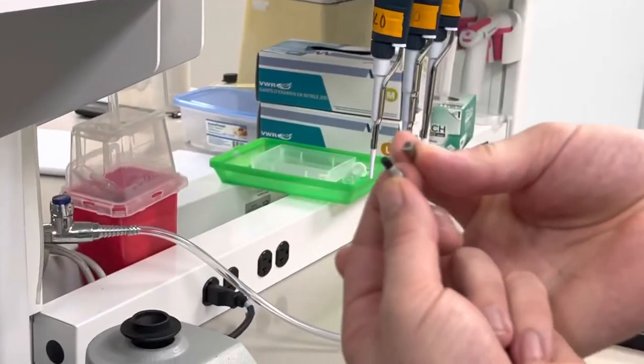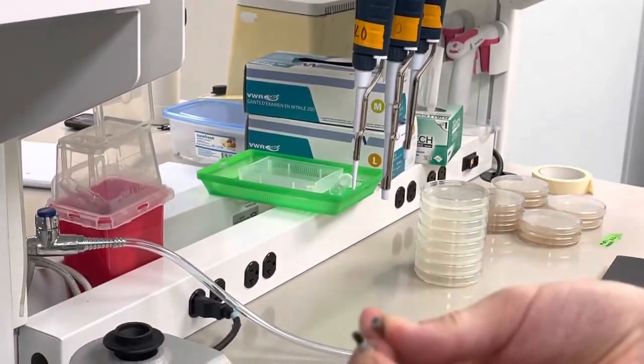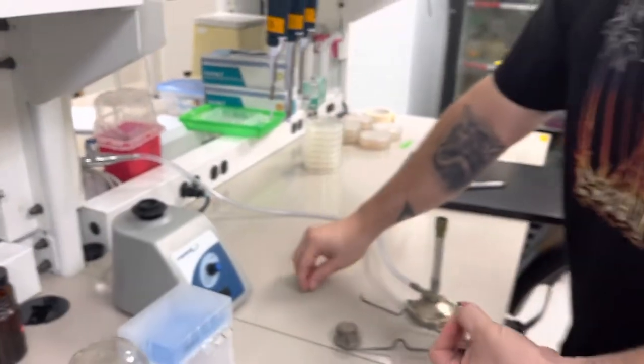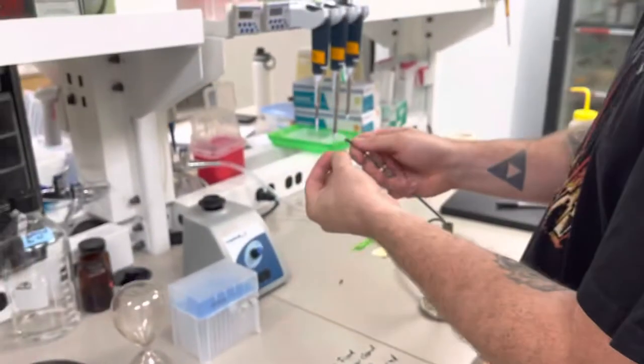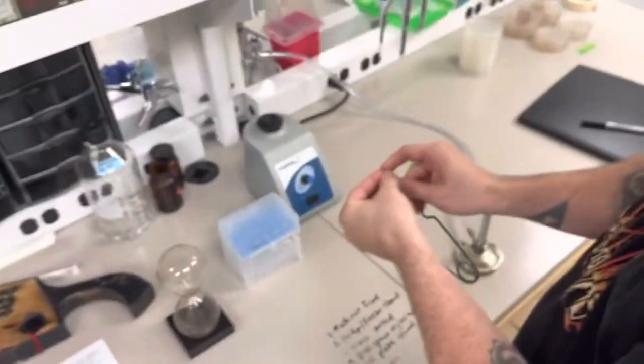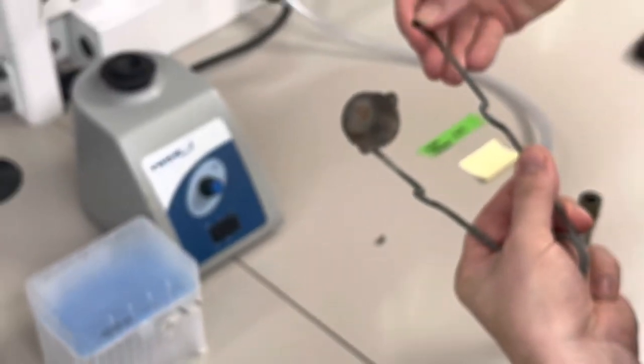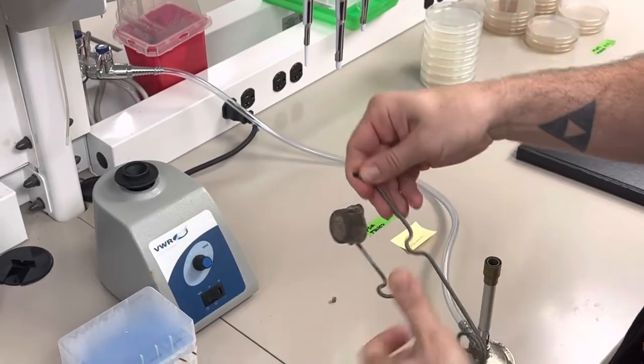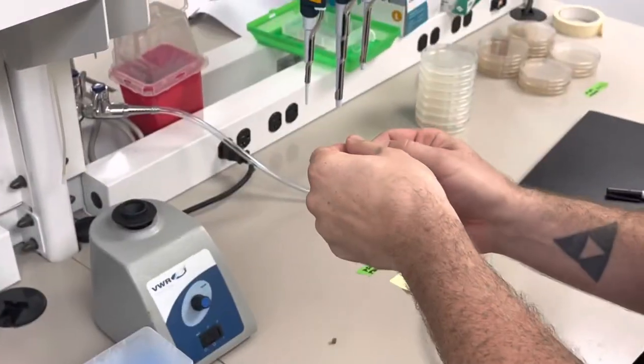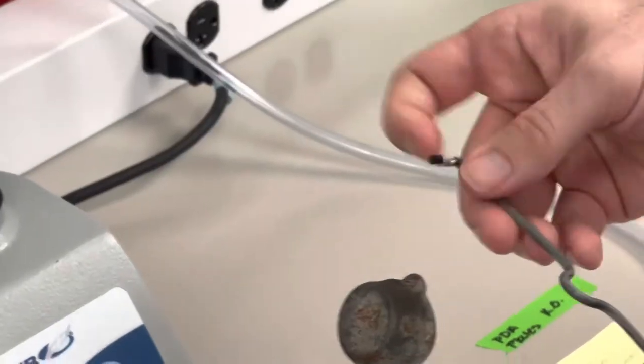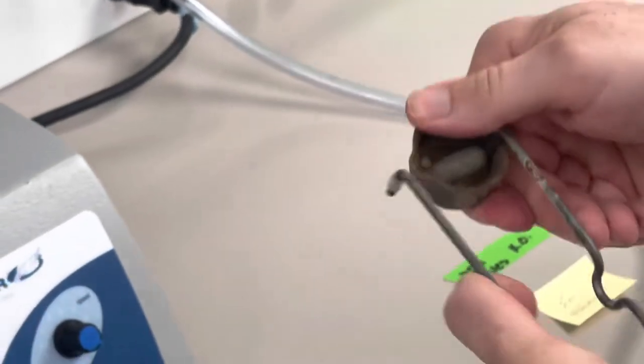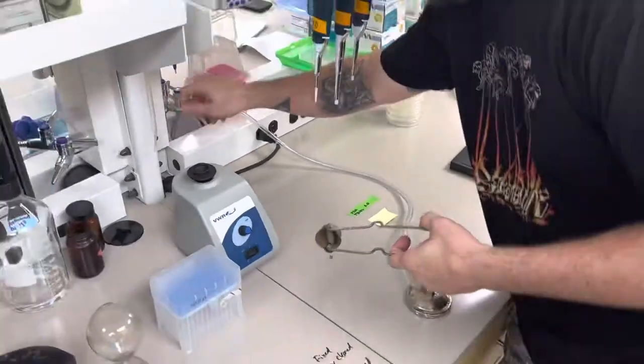Make sense? So all you need to do is screw the new flint on. One piece of flint. There we go. Screw the new flint on and then just pop it back in, and then you should be able to strike it and light it.